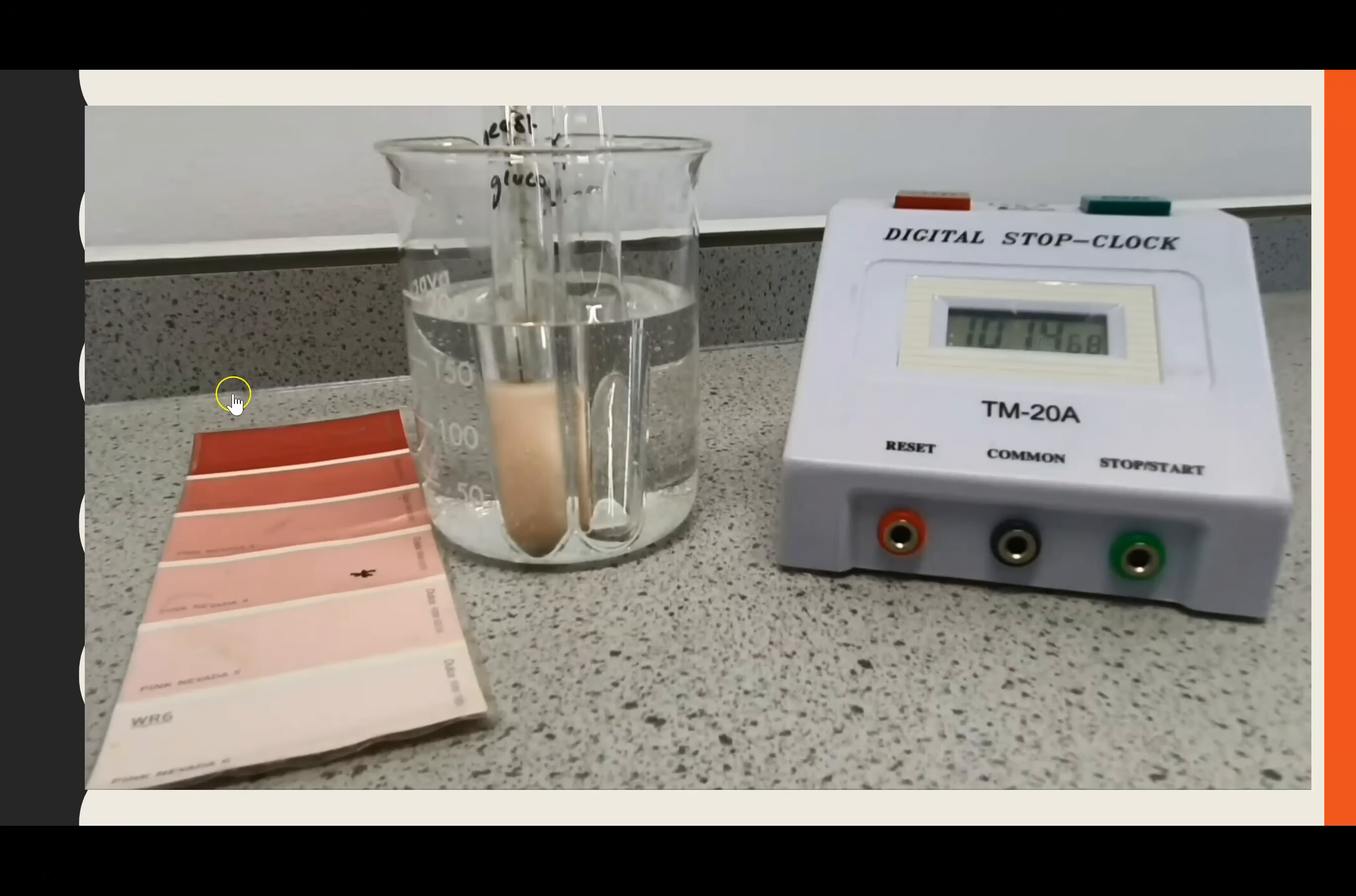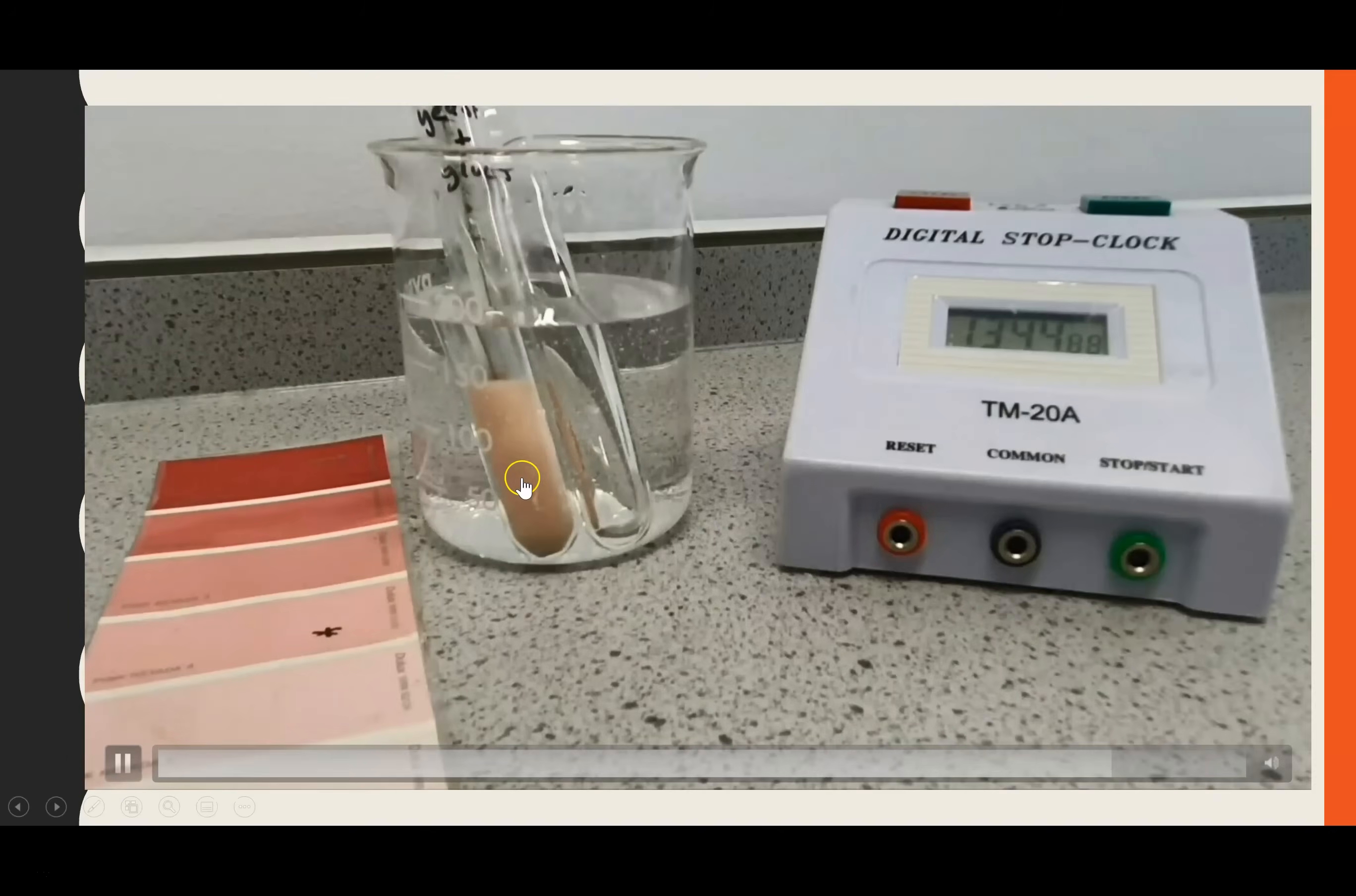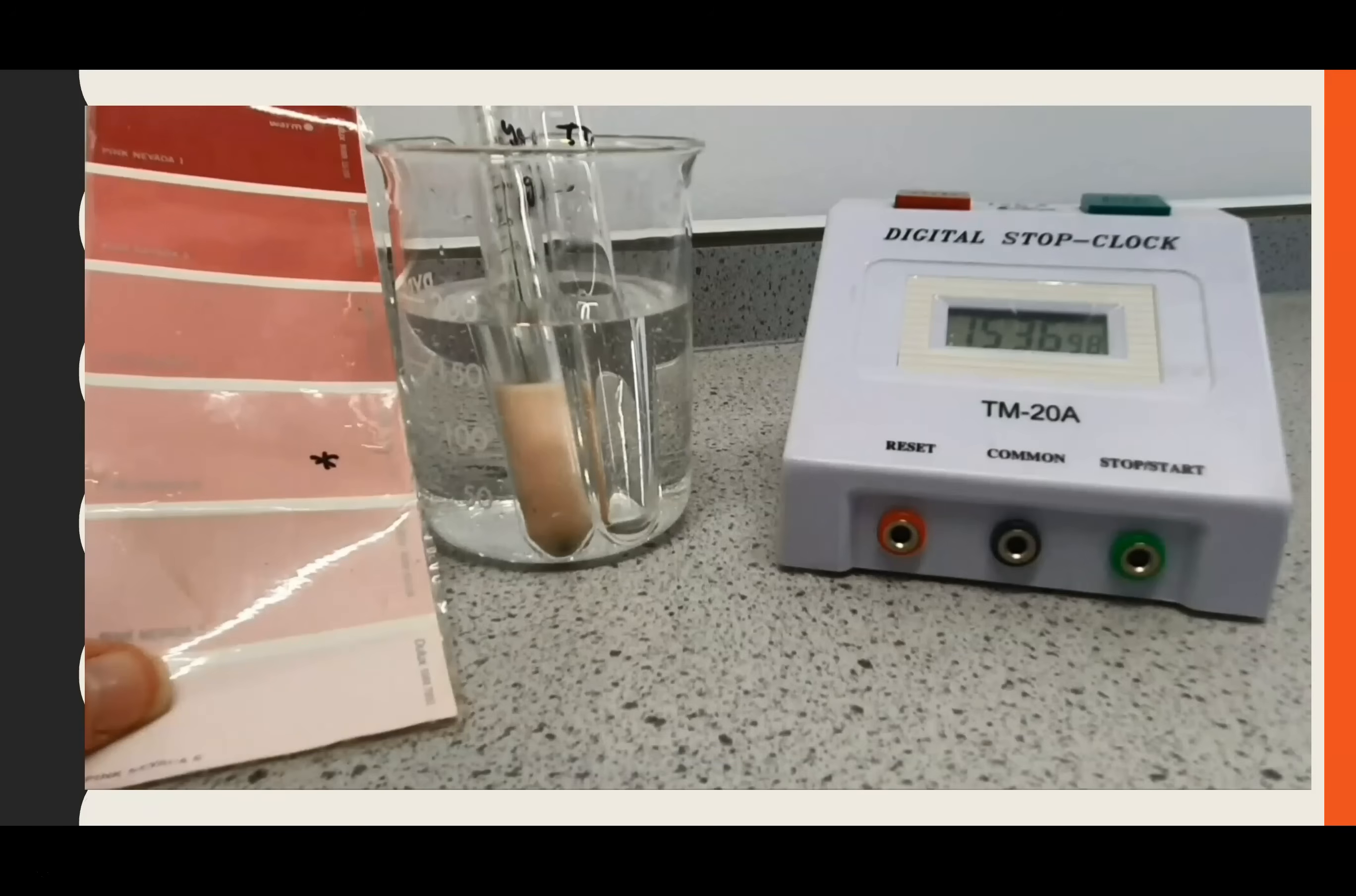I've also taken it out - you can see periodically just to check against the color sheet. And that's what you'll keep doing until you've decided that the color of your solution has matched this. For me, I get to 15 minutes, and it's not quite there. I'm going to show you what the final endpoint should look like.